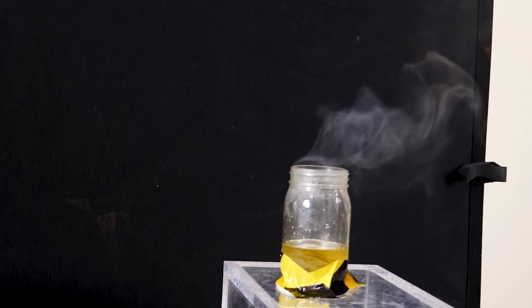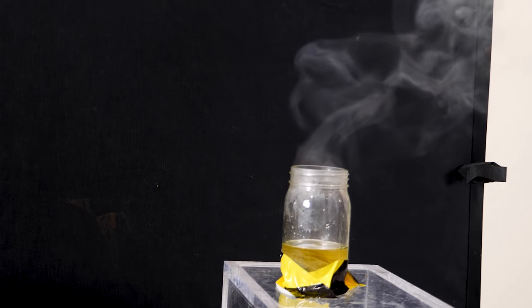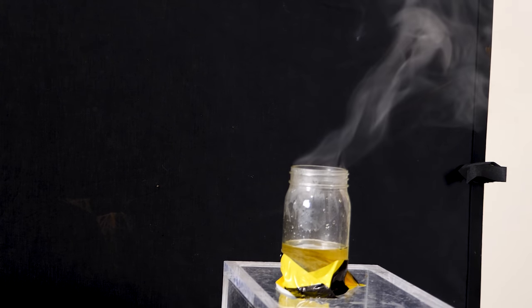Or even just moving your hand near it with a little bit of ammonia on your hands, it looks like your hands start smoking.